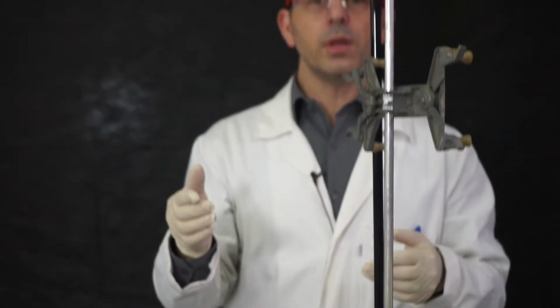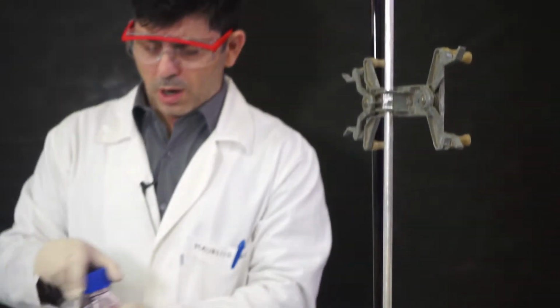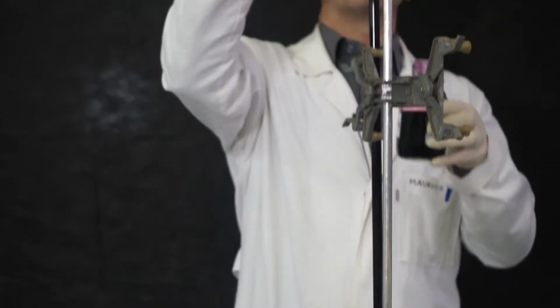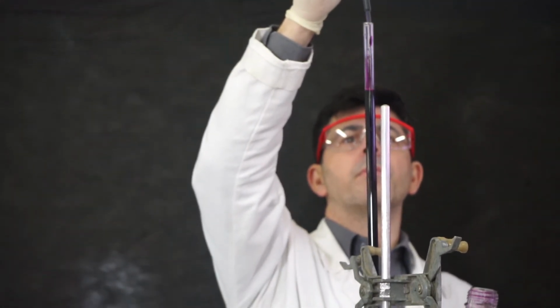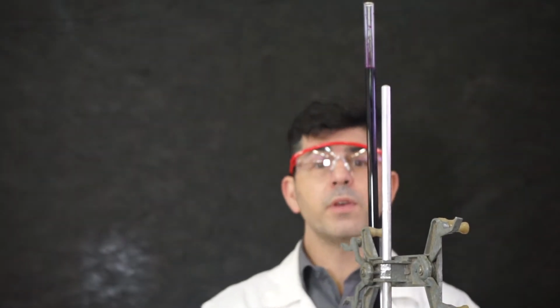It's easy to do this because the liquid is very opaque. I just did it. So what I'm going to do now is use the dropper to add some drops and reach the exact 0. There. Perfect. See, all you have to do is to be very careful.